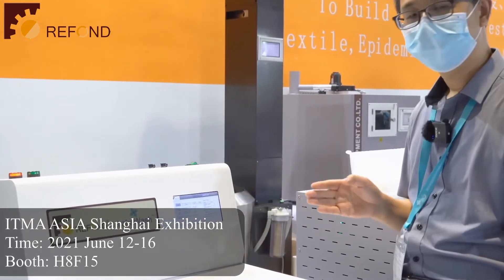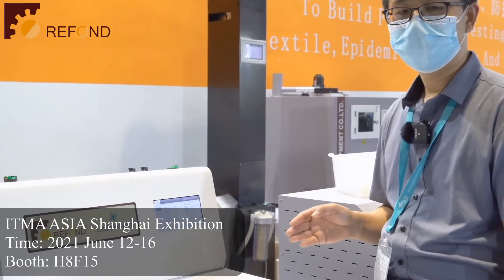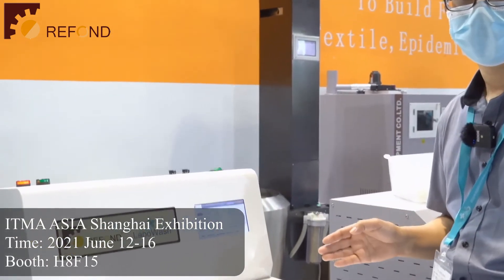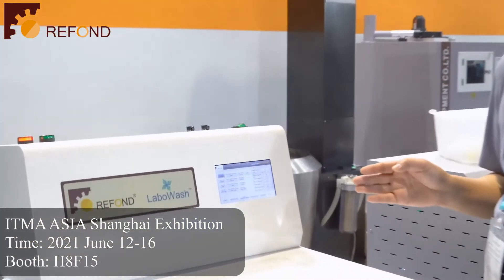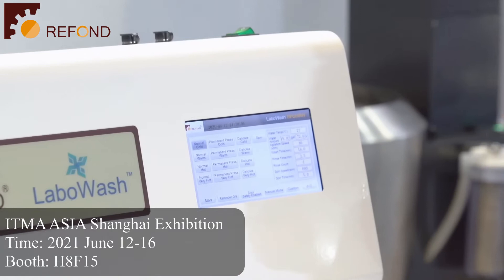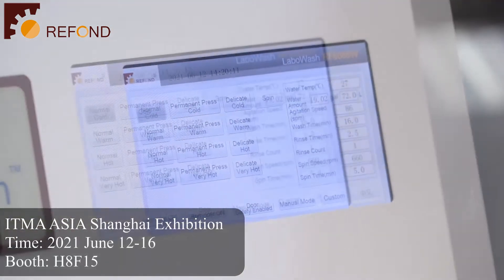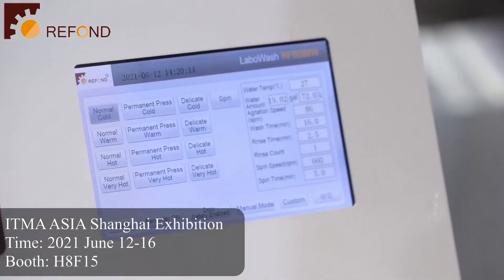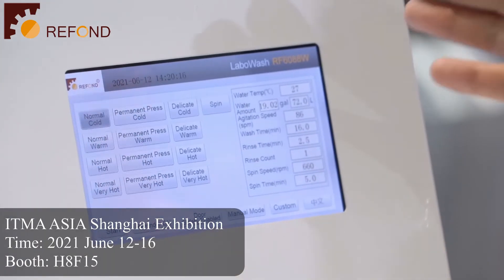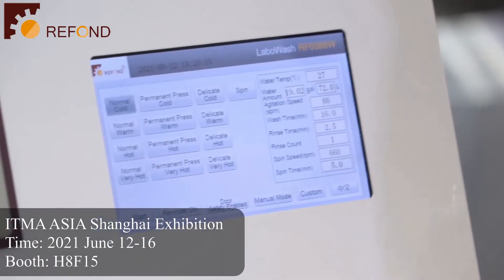You can do 5 cycles, 10 cycles, or even 50 cycles of washing programs for different fabrics. Let me introduce the functions of our machine.